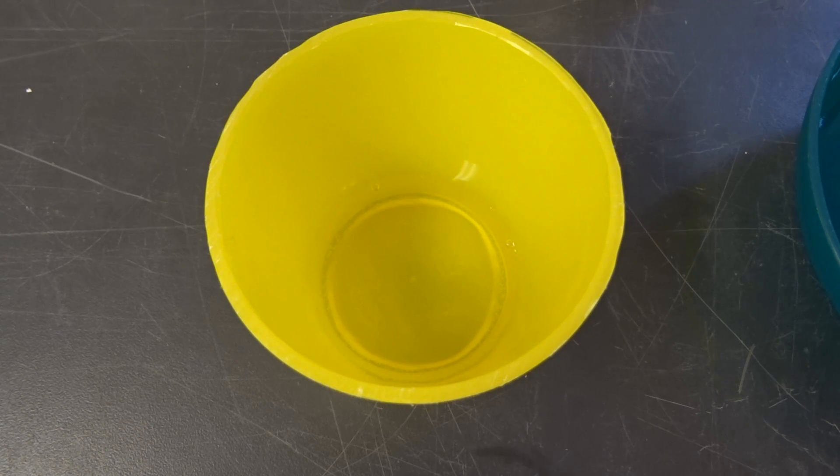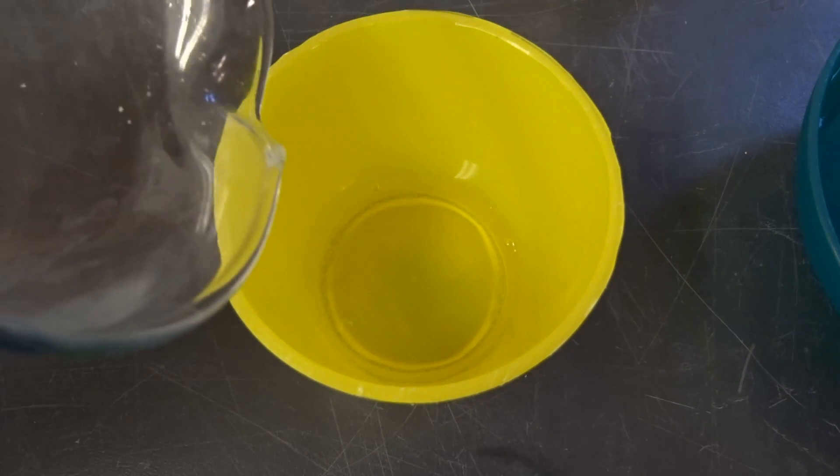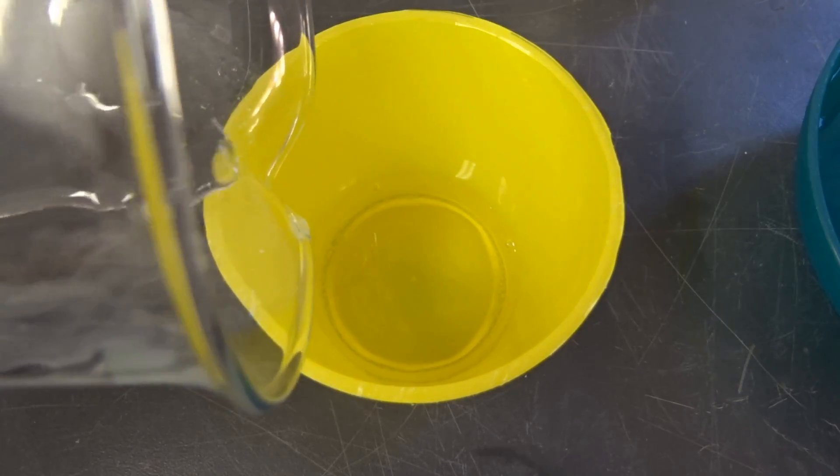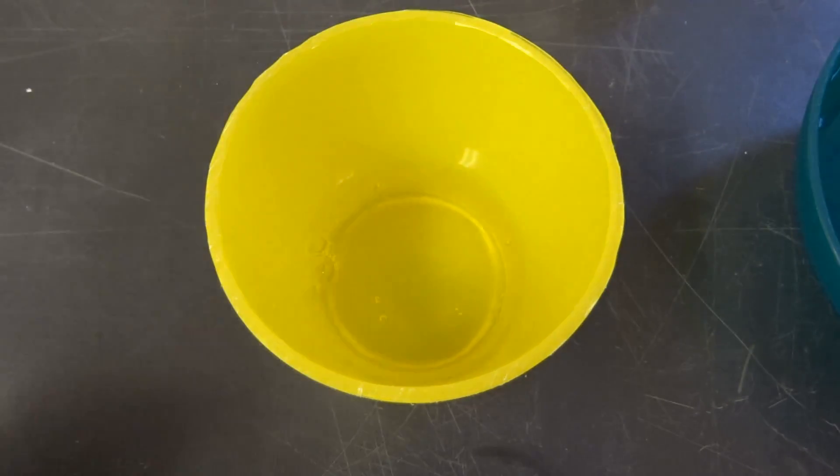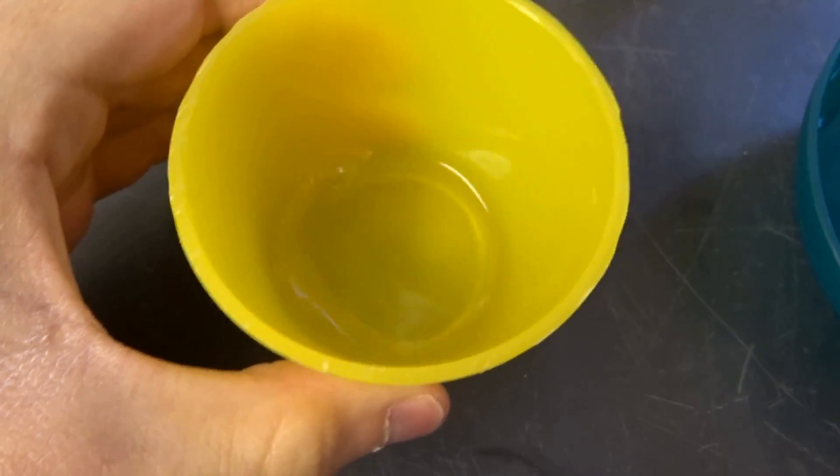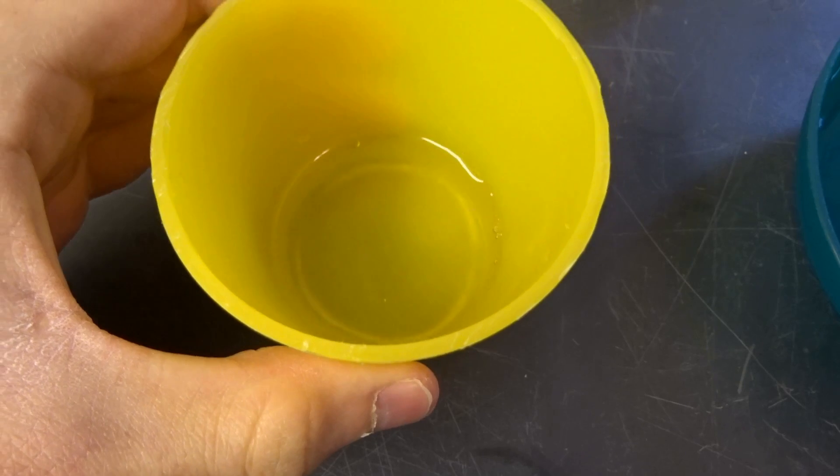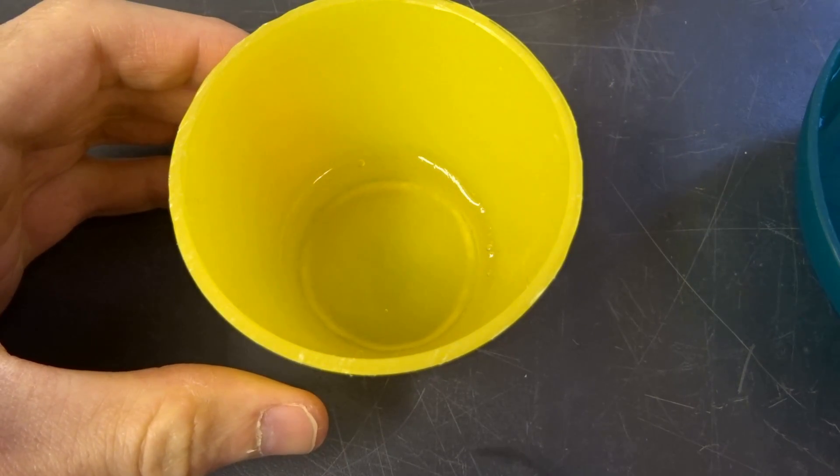And here you can very soon see that the gel will form instantaneously. So now I'm adding the pure concentrated acid, and we already have the gel formed. So here you see it, and there's already some solid stuff that formed here.